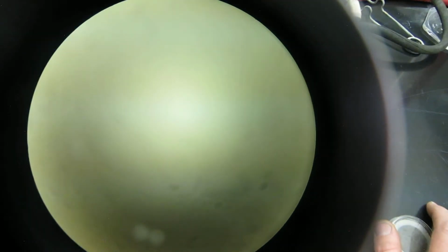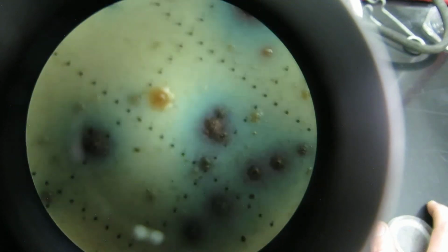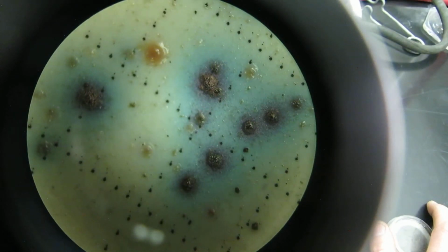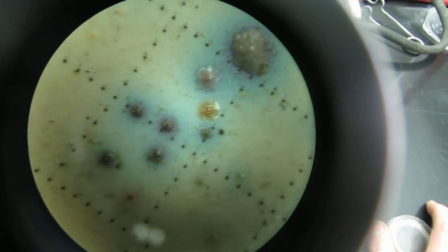So let's look at one of these for the 10 to the negative 1 dilution, where we just looked at 1 tenfold dilution, and I'll explain that in a later video. But this one, for example, we've got the same thing, blue halos, smaller colonies because there's more of them there, and so there's less media for the colonies to actually use.